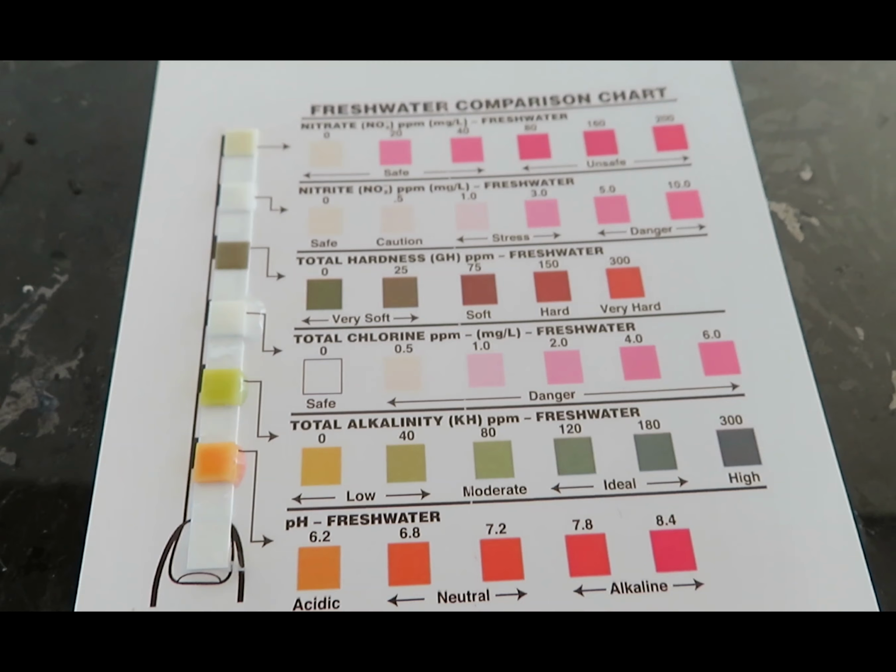On screen now is a table of all the data that I collected. I won't go into a full analysis here, but I wanted to highlight a few interesting points. First, there is some variation among a number of parameters. For pH specifically, my tap water was the most basic sample taken, while the snow was actually very acidic. My tap water was also the most alkaline with a very low hardness. This makes sense because I know my tap water comes from a well and has been processed and has various softeners and filters on it to make it drinkable, and that removes some of the hardness.